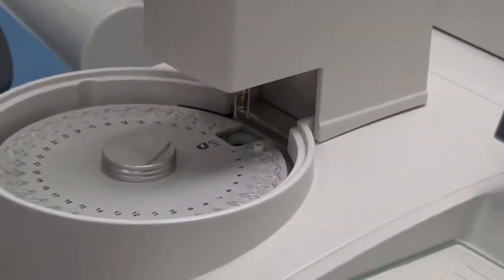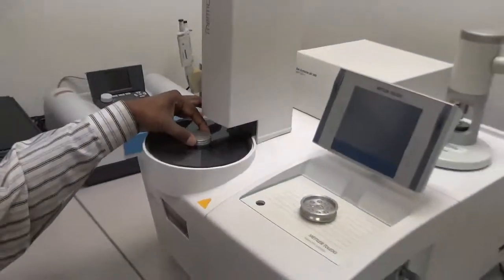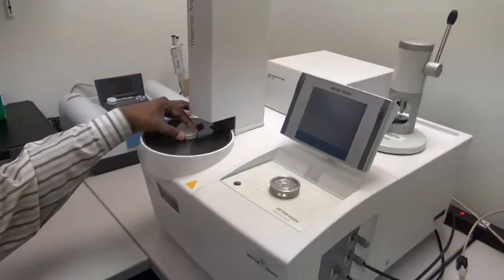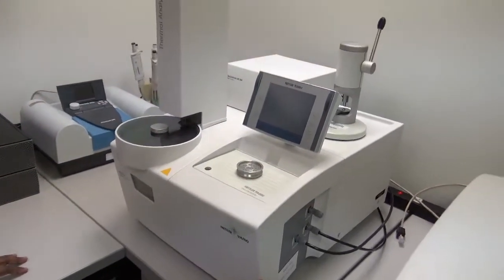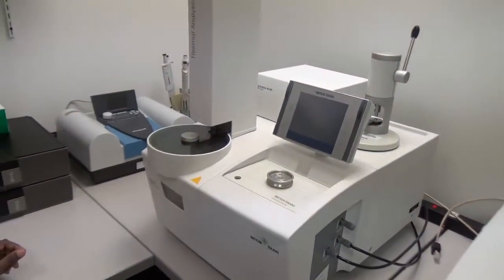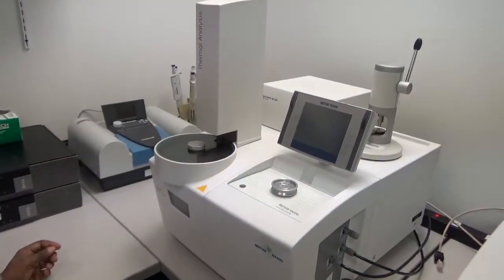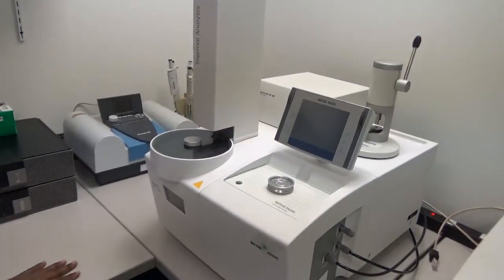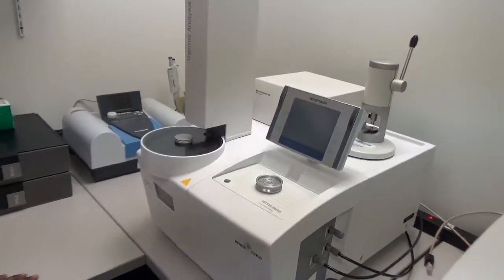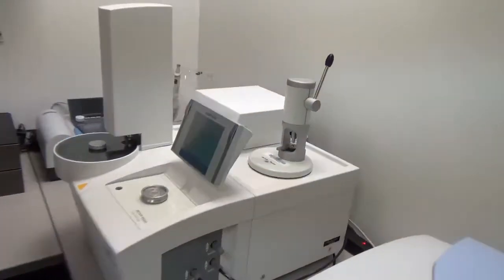To do thermal analysis, we take a powder sample — a very small amount of powder sample — in different crucibles. Let me turn on the machine and I'll show you a run.